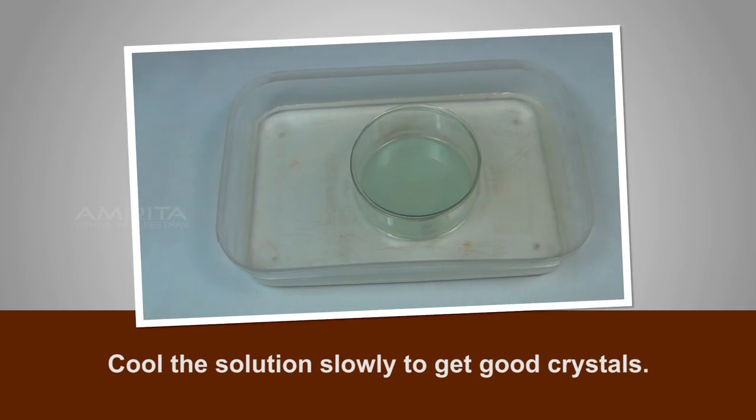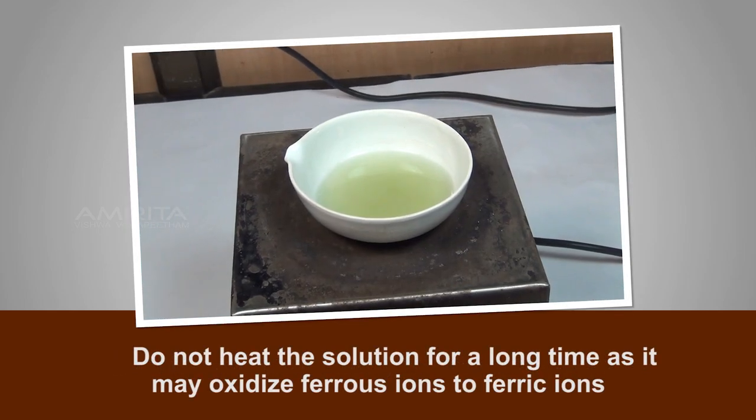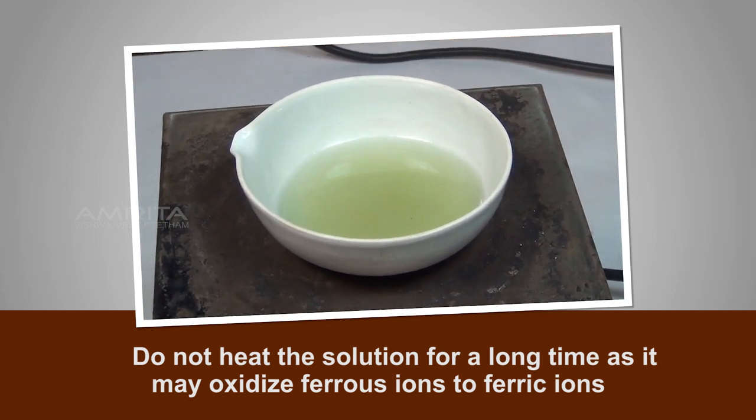Precautions: Cool the solution slowly to get good crystals. Do not heat the solution for a long time as it may oxidize ferrous ions to ferric ions.